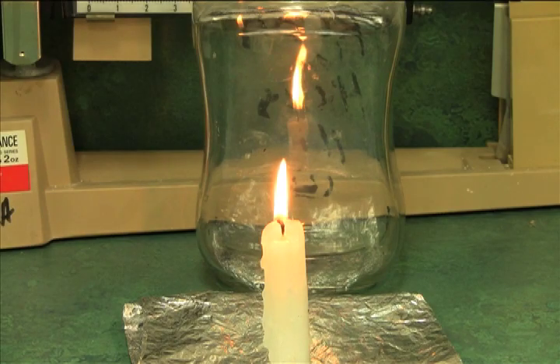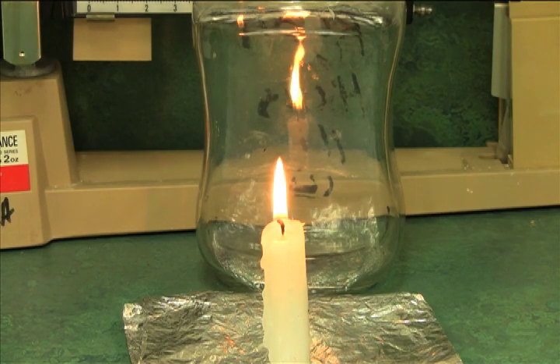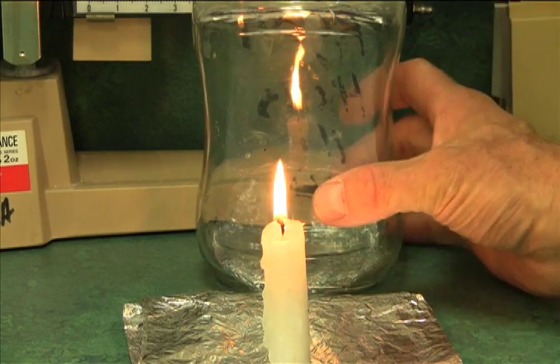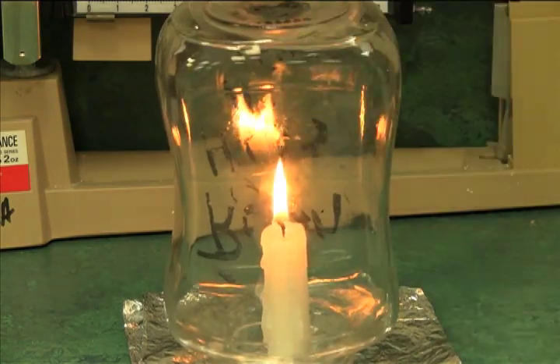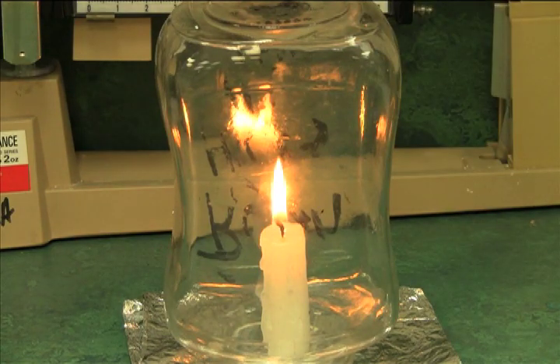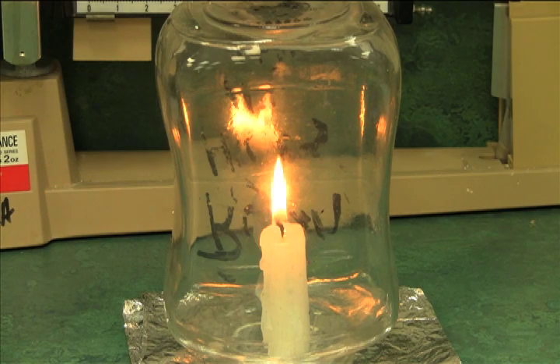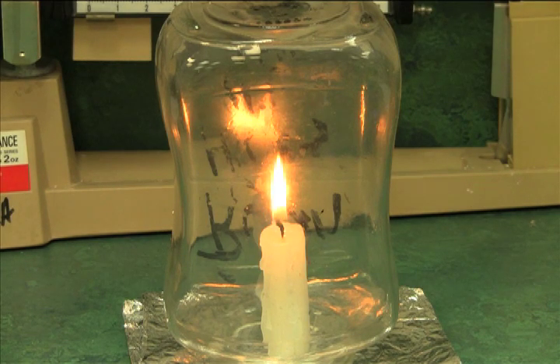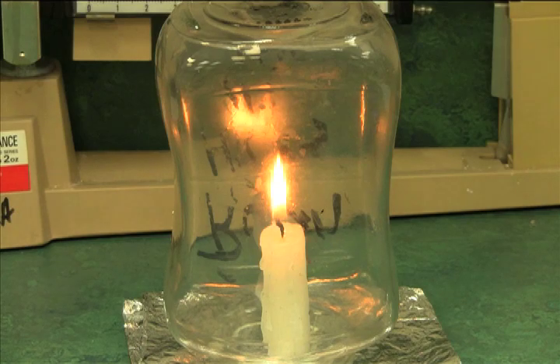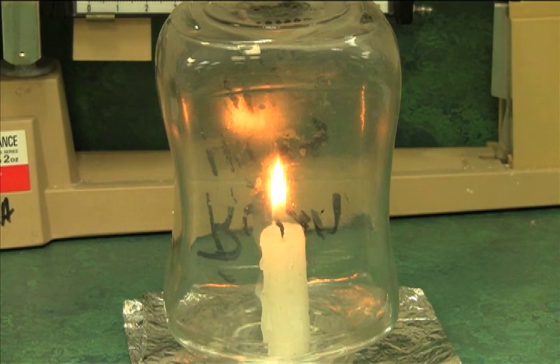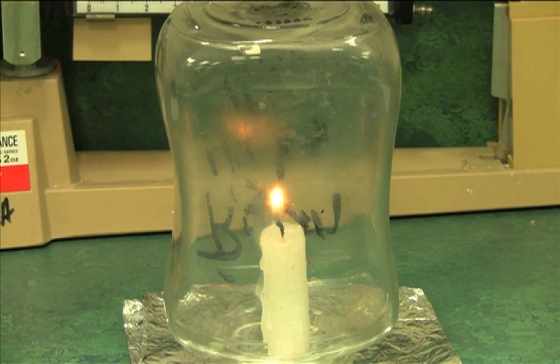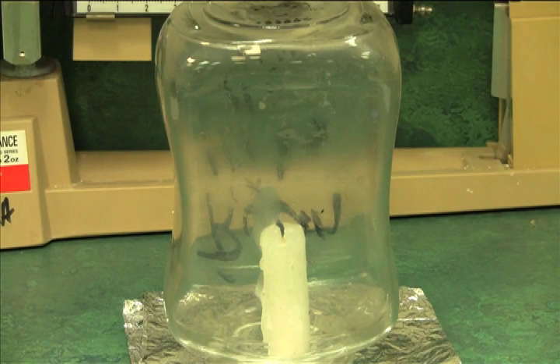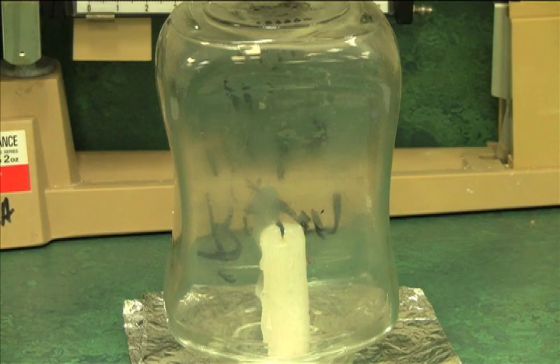We're now ready to finish step seven by timing the second jar. Here I go. We're at four seconds. There's eight. Ten. Twelve seconds. Fifteen. Eighteen. Twenty seconds. And it stopped at 24.3 seconds. We'll go ahead and record that on line seven.